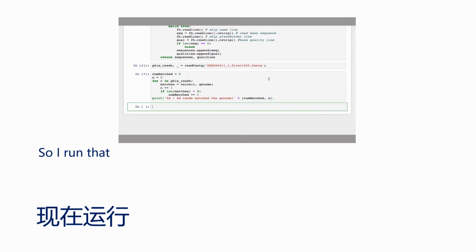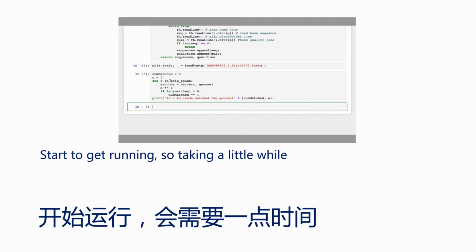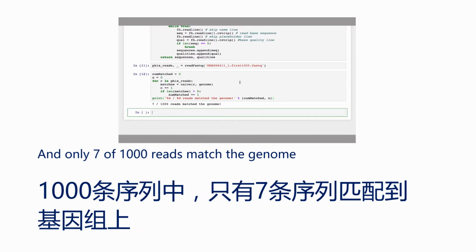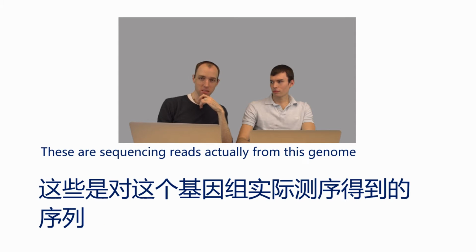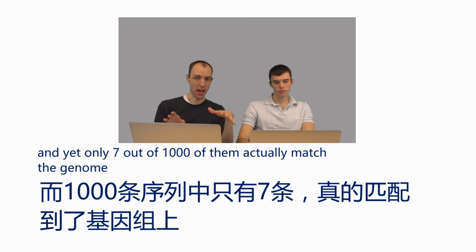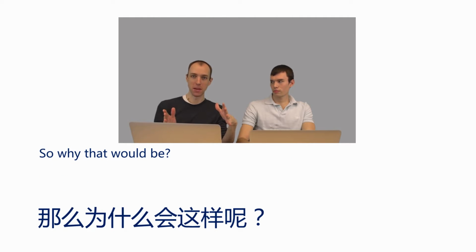So I run that. The star indicates that it's running, so it's taking a little while. And only 7 out of 1,000 reads match the genome. Okay, so that might be surprising, right? These are sequencing reads actually from this genome, and yet only 7 out of 1,000 of them actually match the genome. So why would that be?